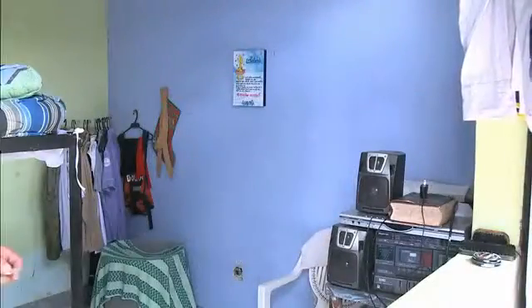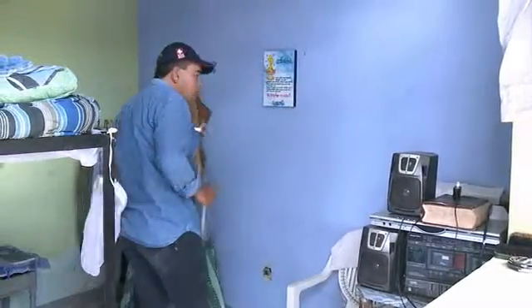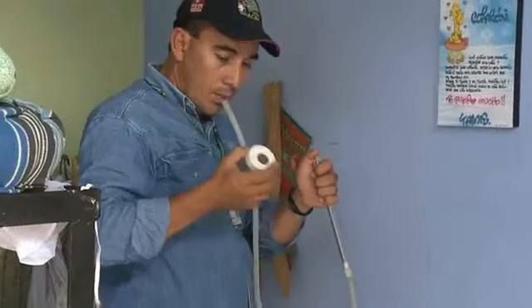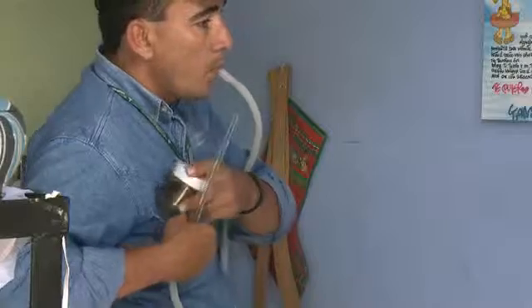When collecting mosquitoes using the aspirator, proceed as follows. Hold the sucking tube with its opening 1 to 2 centimeters away from the mosquito. Move the end of the sucking tube closer to the mosquito and at the same time suck gently but quickly to draw the mosquito into the tube. Place your finger over the tube to prevent the mosquito from escaping. Quickly put the tube into the hole of the paper cup and blow gently into the mouthpiece so as to transfer the mosquito to the paper cup.